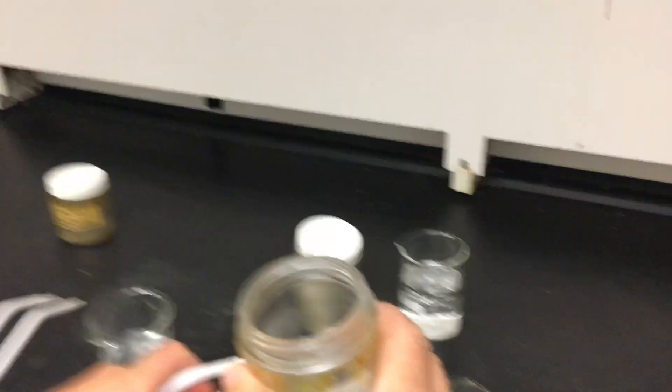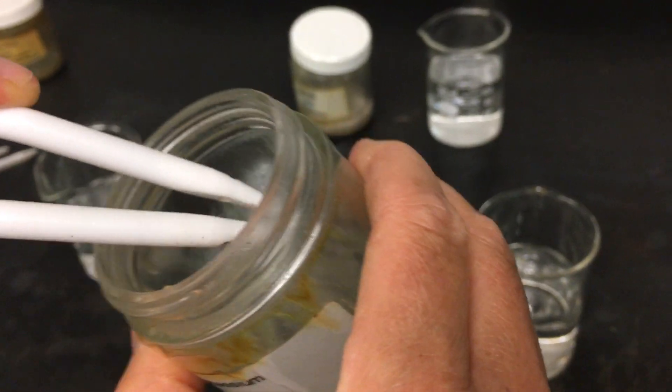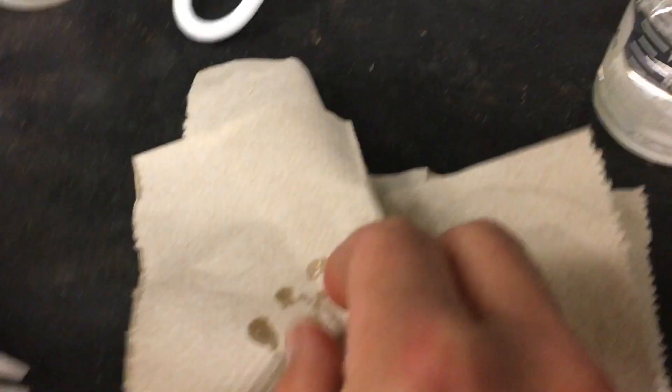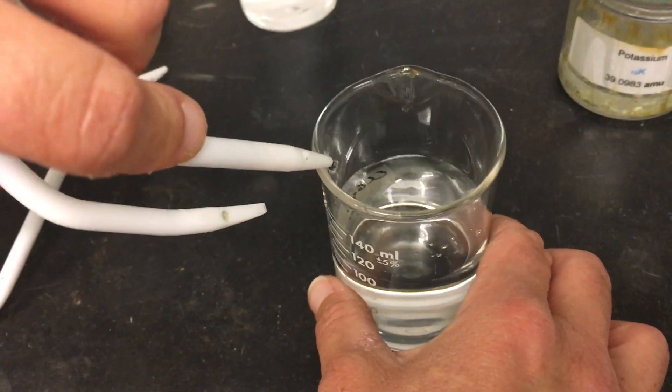Now we're going to do our last one. We're going to look at potassium, which is the next one down on the periodic table in that first column. We have our potassium stored in oil. Let's grab a piece of potassium, dab off the oil, and add it to water. And there was our potassium reacting with the water. So what we looked at is lithium, then sodium, then potassium — see if you can see a trend.